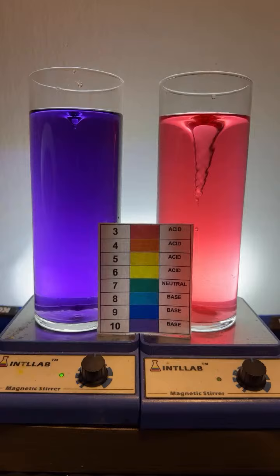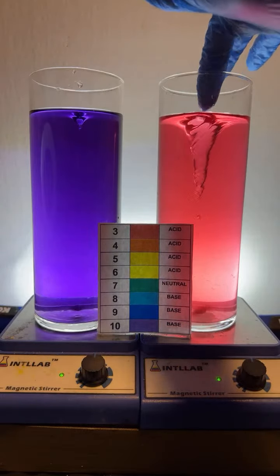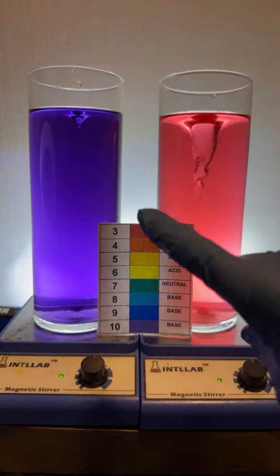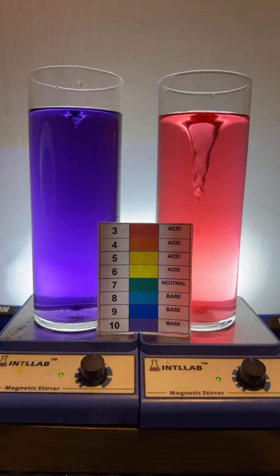Someone wants orange. Add something organic. Here, I'll add my gloved finger. There you go. Latex. Scarlet and violet, you got it right there. The acid, Yashika, I apologize, I didn't catch the name. Oh, crap, what was the question? Man, they come through so fast. It's hard to remember.